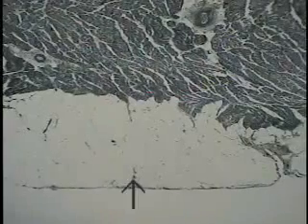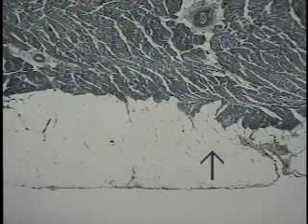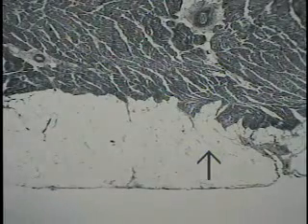It consists mainly, as I mentioned before, of fat and connective tissue, and it is this thick fatty layer that will house the various named vessels that one will dissect out in the gross lab. So when the students are digging out those named vessels and tracing them on the exterior of the heart wall, what you are actually digging in is this epicardial layer. In this particular case, it's fairly thin.